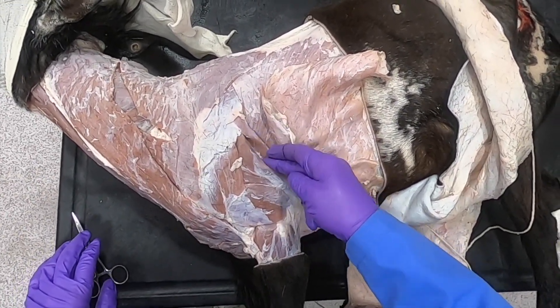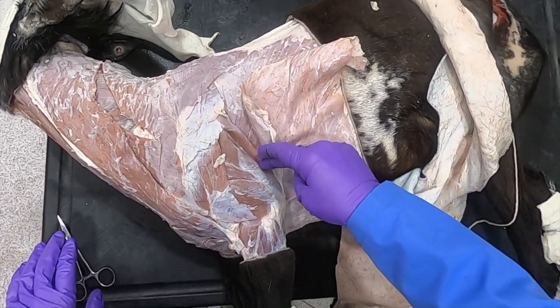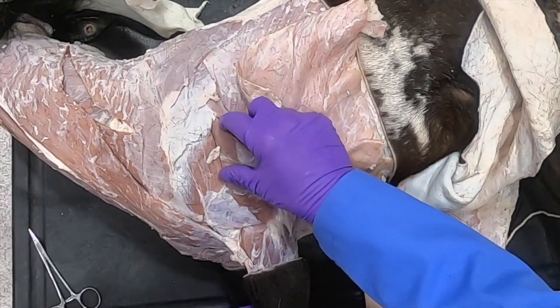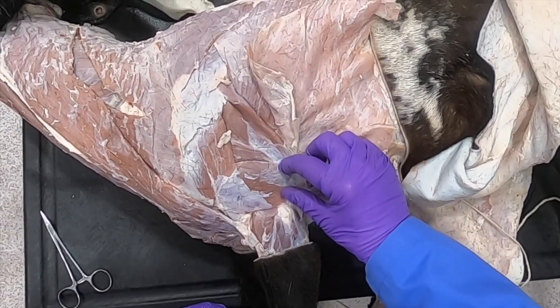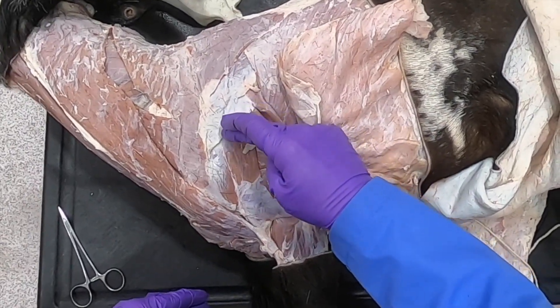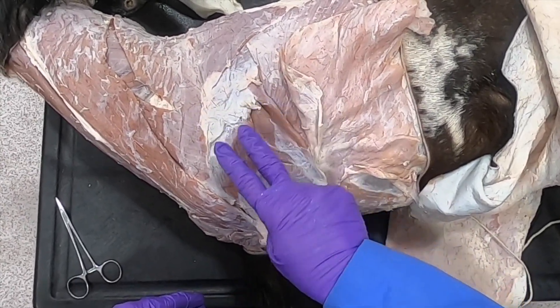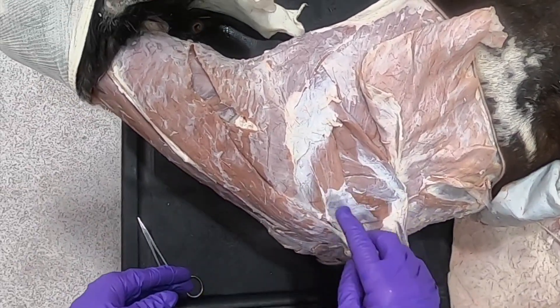As a little preview before we get to all the muscles of the limb: this thin structure here is the tensor fasciae antebrachii muscle. Here we can see the long head and the lateral head of the triceps brachii — extensors of the elbow. Just as in the dog and the ox, we have both a spinous portion and an acromial portion of the deltoideus muscle, one of our major flexors of the shoulder.